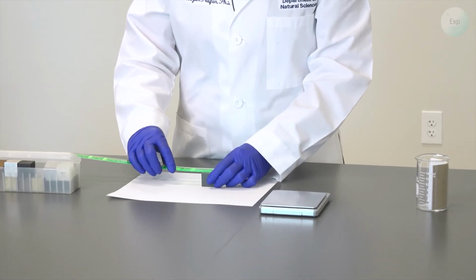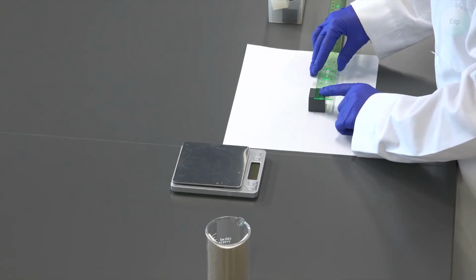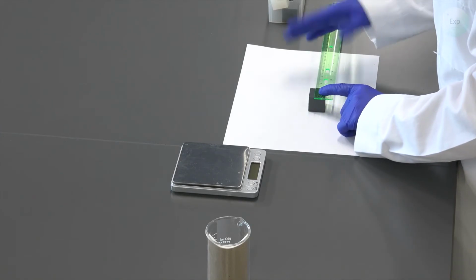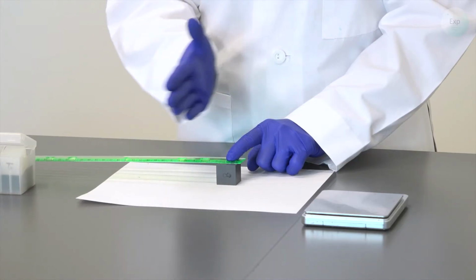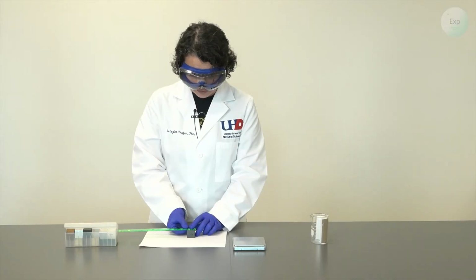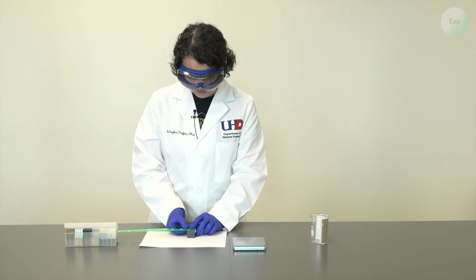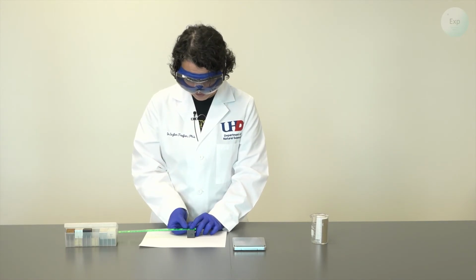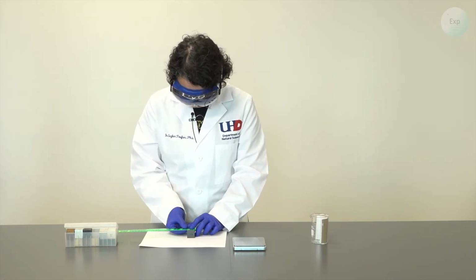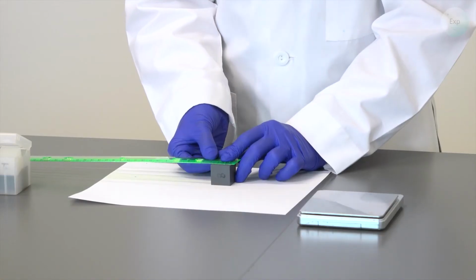So I am going to place my ruler so that my first gradation is neatly lined up with the left of my cube, and I am going to measure it all the way to the right. In order to record our length measurement, we're going to assume that we start at the 0 mark, and we're going to figure out exactly how many decimal places will follow that 0. And it goes all the way to the 2.5. Except if we have it correctly oriented, it goes slightly over.